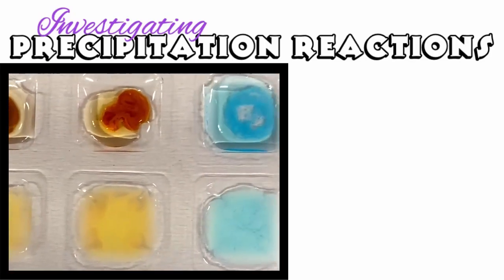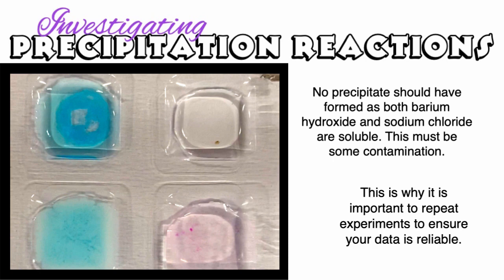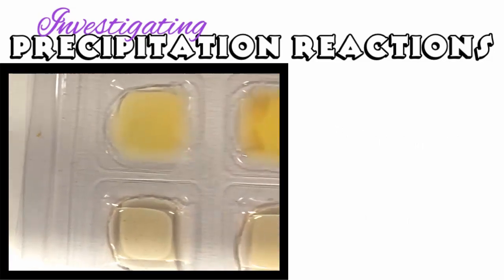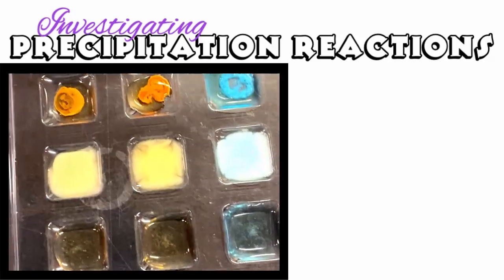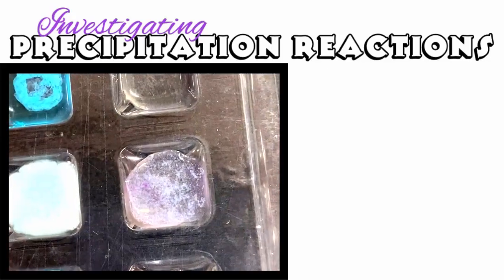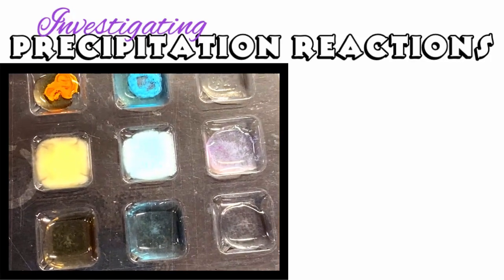You can see here that a precipitate has formed between the barium chloride and the sodium hydroxide, and actually there should not be a precipitate formed there. And so what's actually happened is there must have been some sort of contamination. I wanted to leave this in here because even though it shouldn't have happened, it really does demonstrate the importance of repeating your experiments to look out for things like that. That contamination shouldn't have been there, but if I only did this experiment once, then I wouldn't know that. I would just assume that that was the normal thing for it to happen.